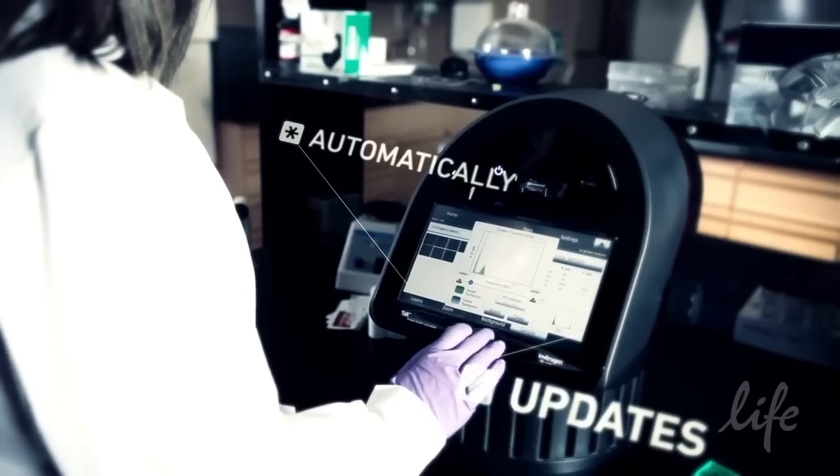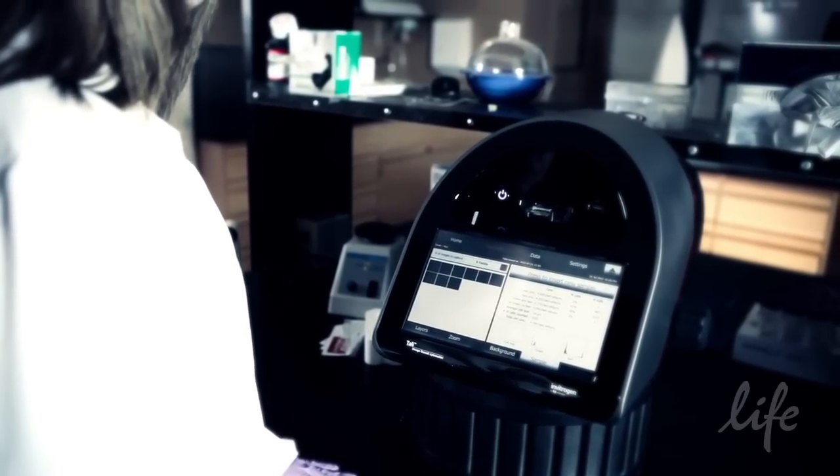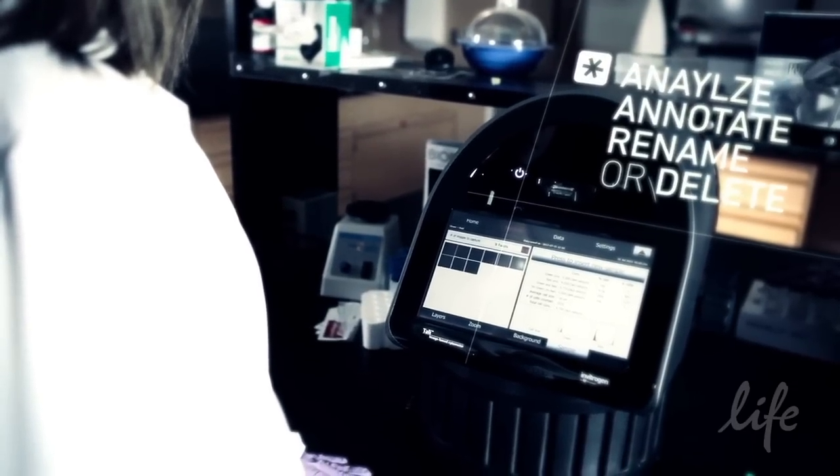TALI has internal memory for storing data from up to a thousand sample runs. You can access the stored files through the data tab where you can analyze, annotate, rename or delete them.